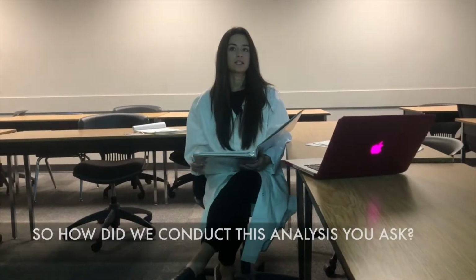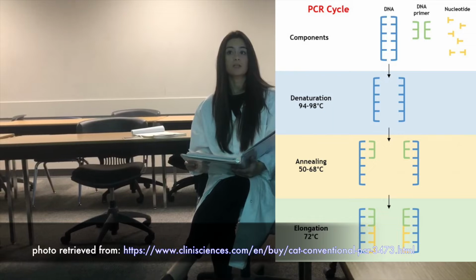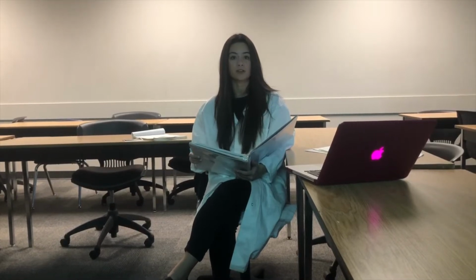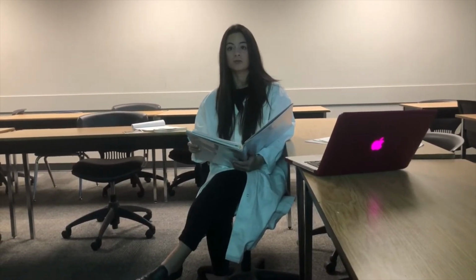To conduct the VNTR and STR analysis, PCR was required to amplify the DNA at the crime scene. PCR works by copying a specific sequence of DNA over and over again. To begin PCR, a template strand containing the DNA sequence of interest, primers that anneal to the beginning of the sequence of interest, a heat-resistant DNA polymerase called Taq polymerase, dNTPs, and magnesium chloride are added to the reaction mixture. There are 4 steps in the PCR procedure: denaturation, annealing, extension, and repeat.